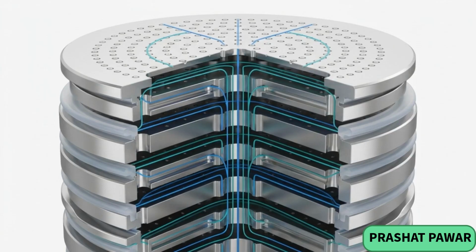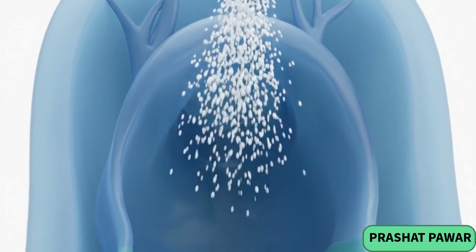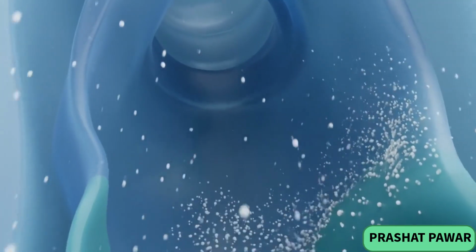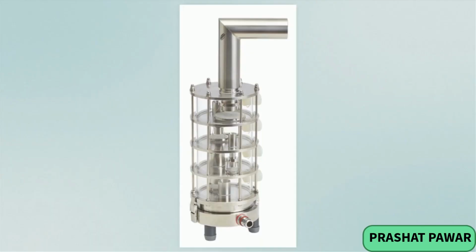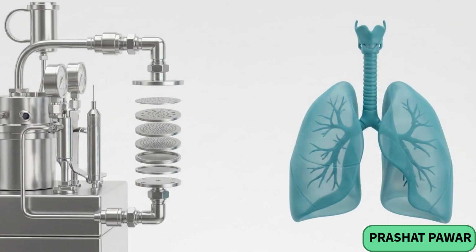A Cascade impactor functions as a near-perfect aerodynamic sorter. However, human airways are highly imperfect impactors. The throat and nasal passages dynamically filter and trap aerosol droplets long before they can reach the deep lung. Traditional Cascade impactors interface with inhalers using a simple, right-angled stainless steel tube known as an induction port. While this geometry provides a standardized test, it fails to replicate human regional deposition. This discrepancy creates a gap in in vitro to in vivo correlations.